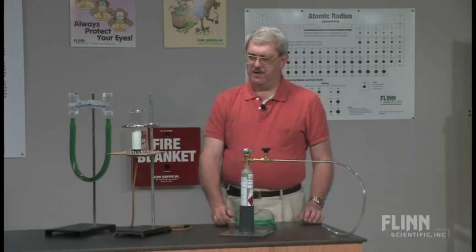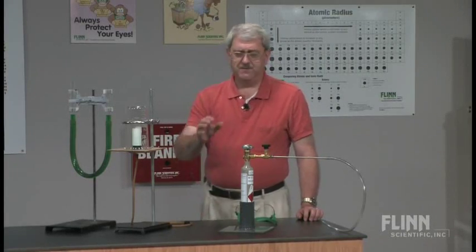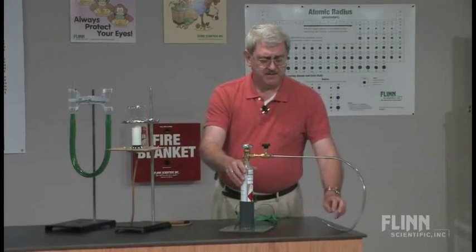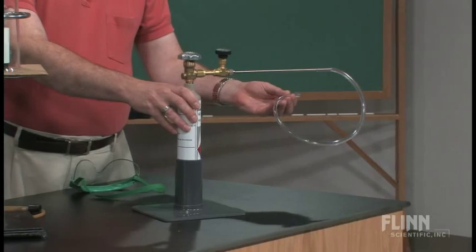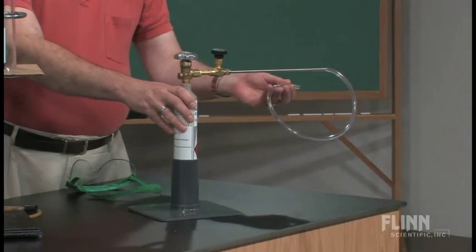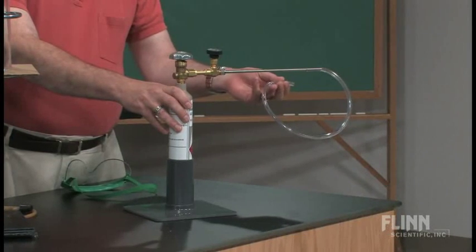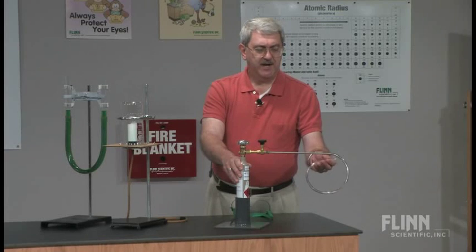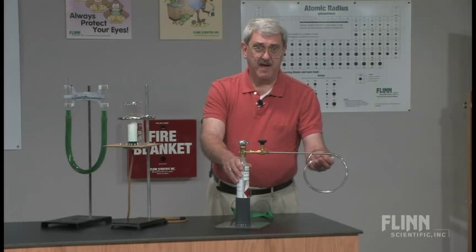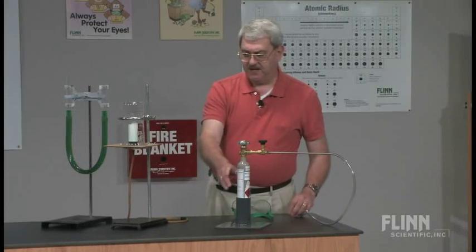There's a lot of equipment that we're using with this that the students may or may not be familiar with. First of all, we're going to be using some hydrogen gas. I have a cylinder tank of hydrogen gas. You may not have that — it may be something you want to generate. You can use other gases in this experiment other than hydrogen gas, but hydrogen will give you the most dramatic results.